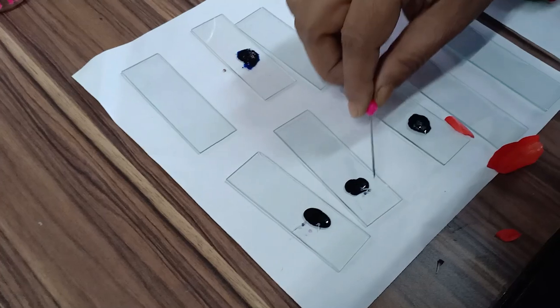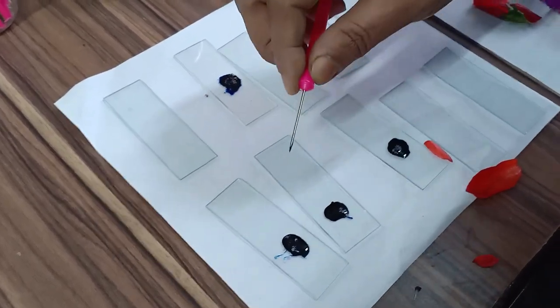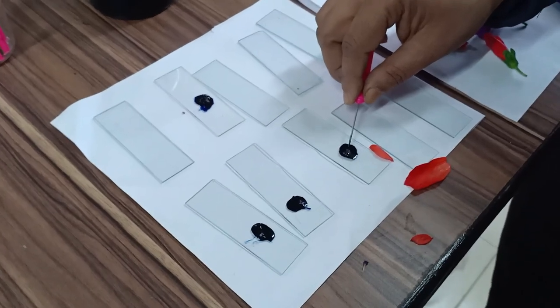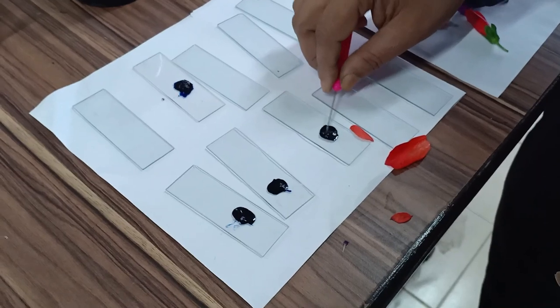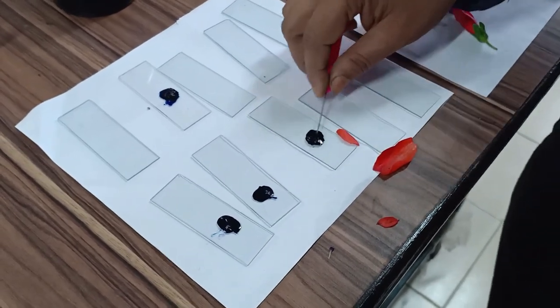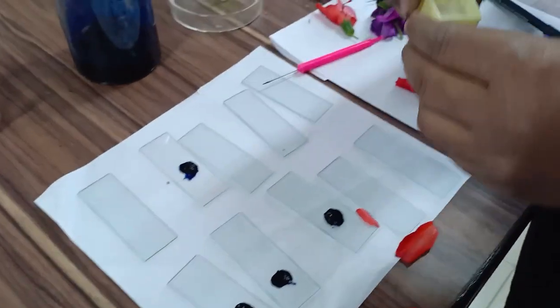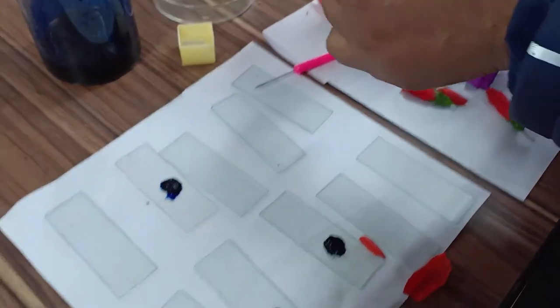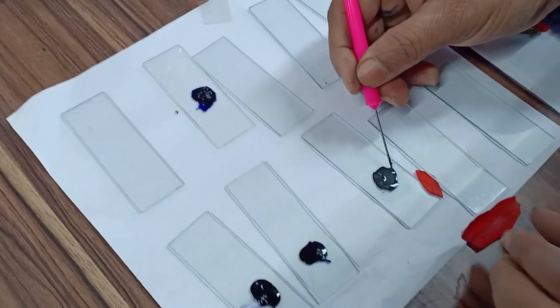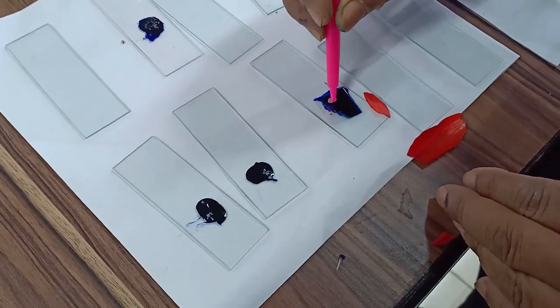First mix the pollen grains in the Evans blue solution and leave for 10 to 15 minutes. After staining, remove the anther and disperse with needles so the pollen grains come into the dye. Place the cover slip in a tilted position and slowly lower it to remove all air bubbles.